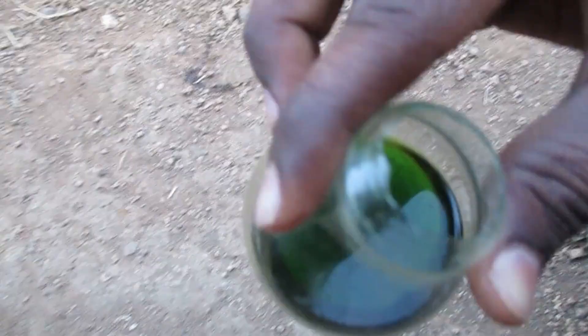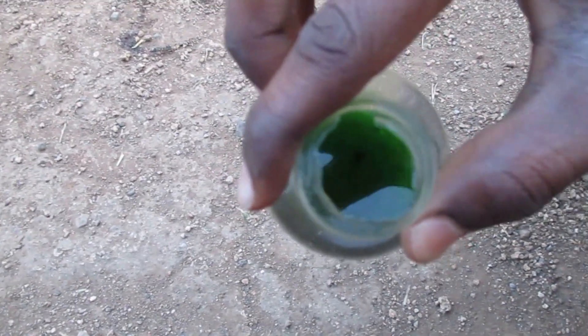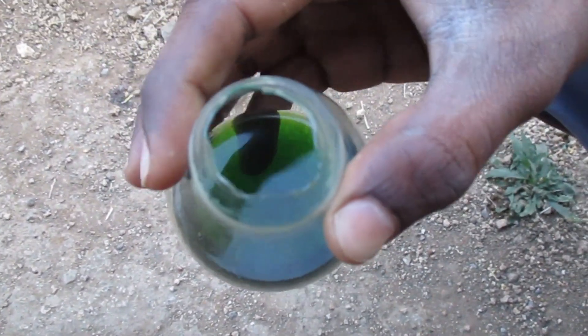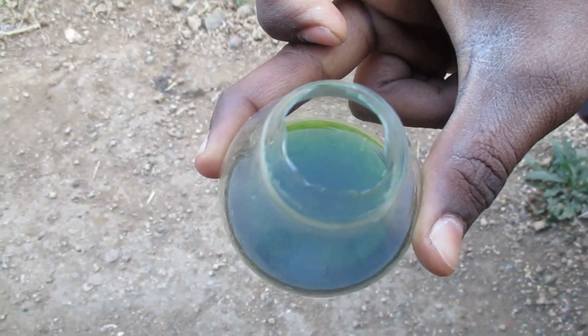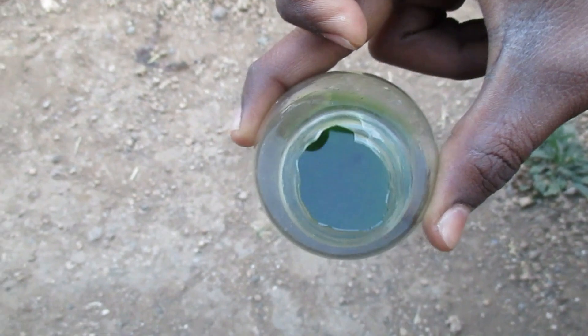So what we learned: when you put the tungsten into the hydrochloric acid, it changed to the green color. Now it is no longer hydrochloric acid — it has converted to tungsten chloride.